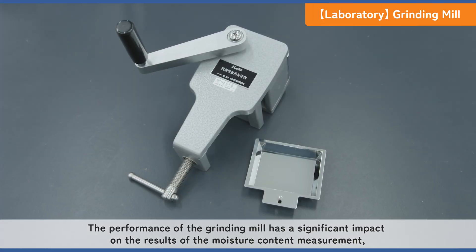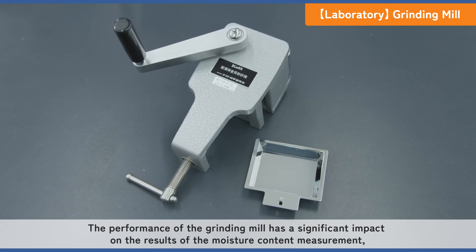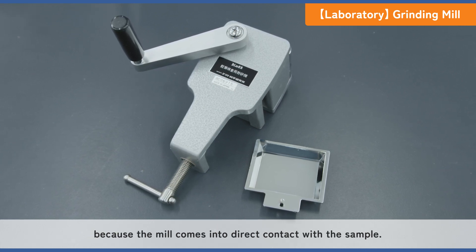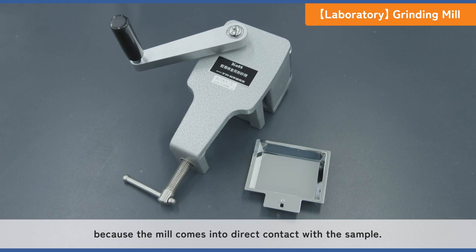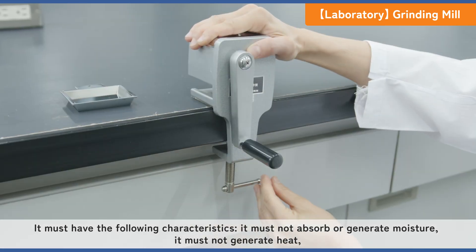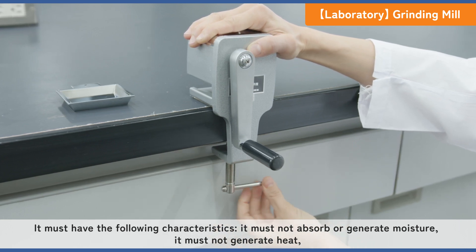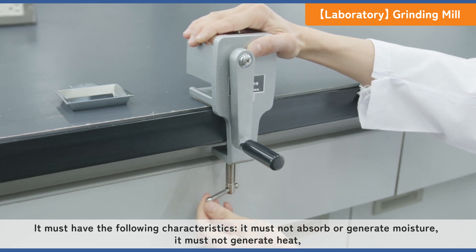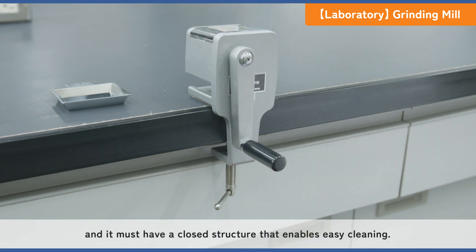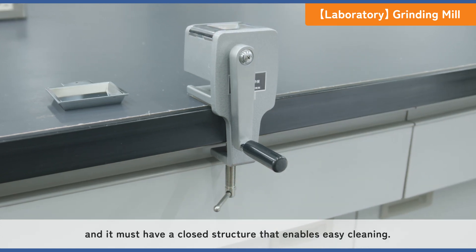The performance of the grinding mill has a significant impact on the results of the moisture content measurement because the mill comes into direct contact with the sample. It must have the following characteristics: it must not absorb or generate moisture, it must not generate heat, and it must have a closed structure that enables easy cleaning.